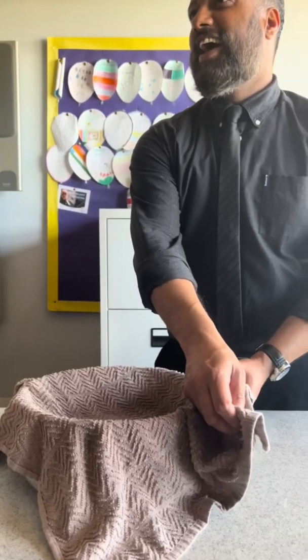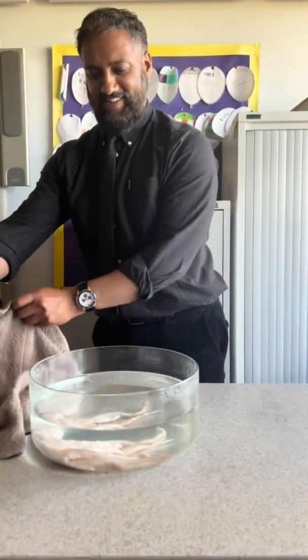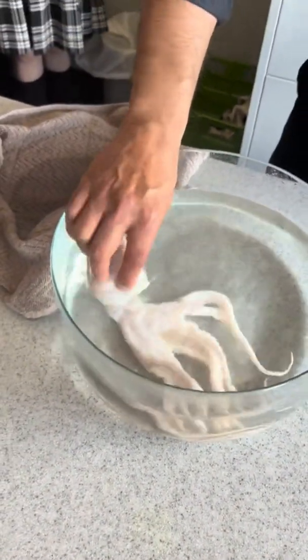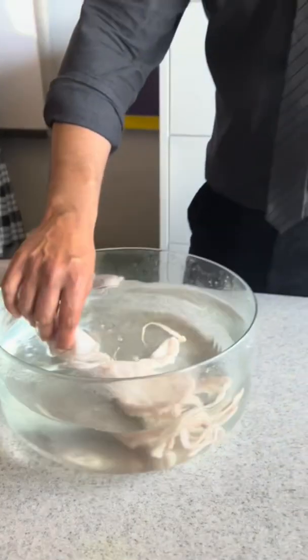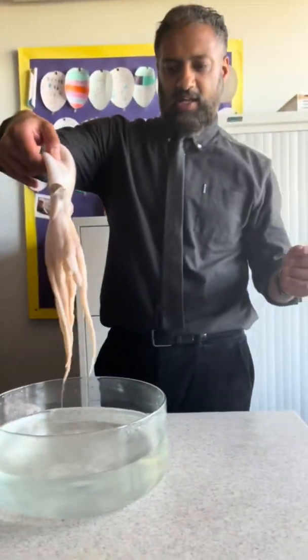Are we ready? No. I'm going to kill it first. That's actually disgusting. Why are you picking it up? Hold up. Wait a minute. Something ain't right. My eyes isn't there. I'm trying to see. It's already dead. It's already dead.